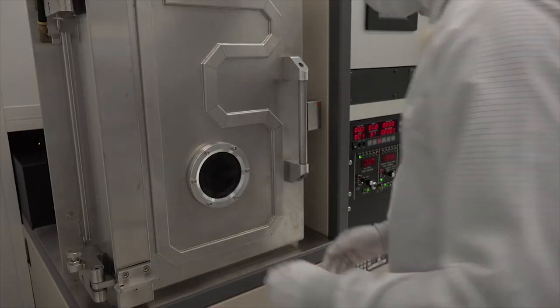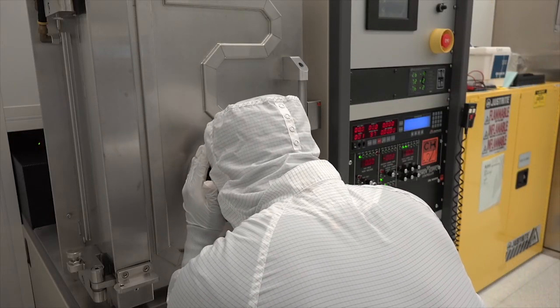The process is automated, so the computer controls the electron beam power and time, and monitors the thickness using the thickness monitor. After a minute or so, the electron beam has heated the crucible enough that it begins to glow. We can look through the glass viewport into the chamber and see the glowing crucible. At this point, the gold has melted. It will be heated a little more so that it readily evaporates.